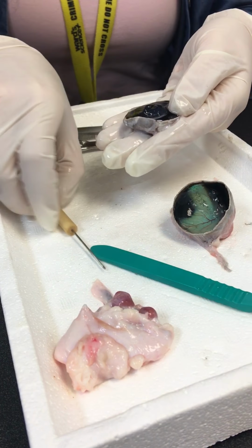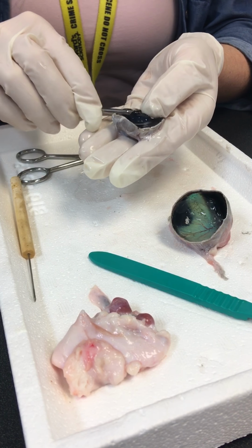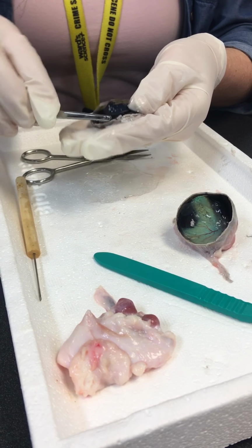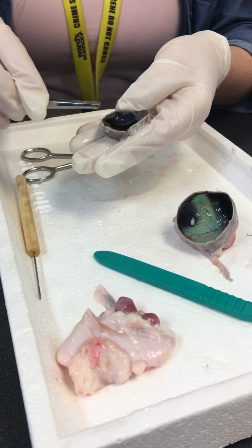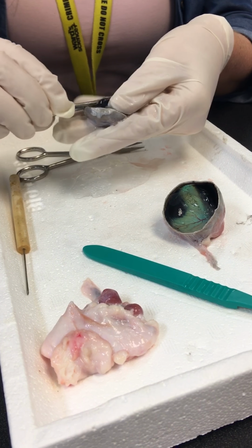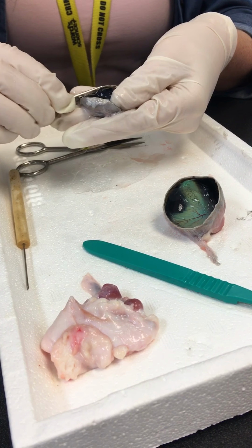Let's see. That's so weird. Like it's just clear fluid in our eye. Is it salty, like saline? There's a fair amount of potassium in this fluid, definitely. Okay, you guys see another clear structure in there? What do you think that is? Lens. Yes. So the lens, remember, is behind the cornea and the iris.